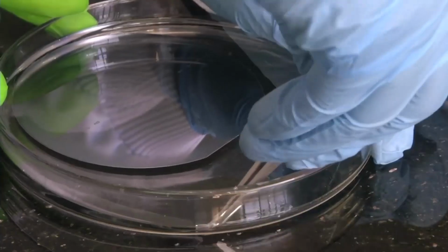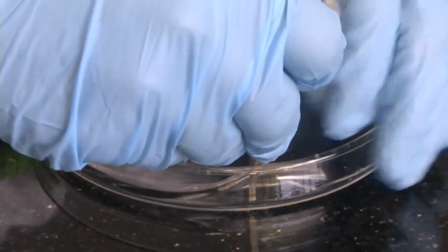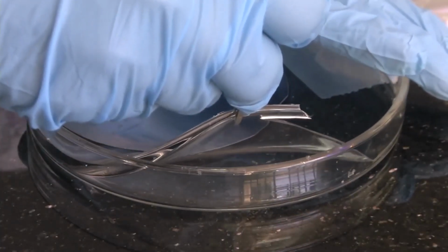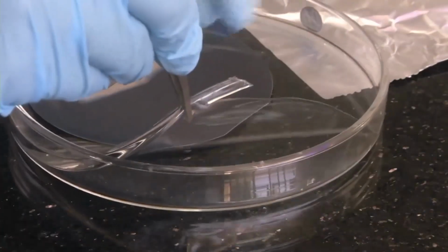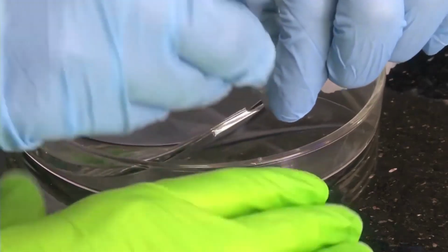So now we will try to peel it off. So you can slowly see now the membrane. See, it is very clearly visible. It's a very transparent membrane, and we are peeling it off now. See, it is very transparent but flexible also. It is like glass but flexible. It's like flexible glass.